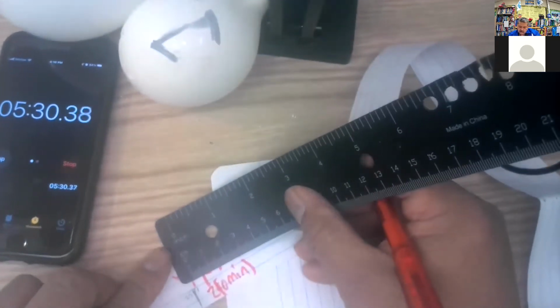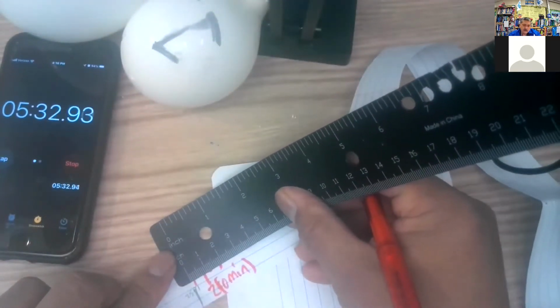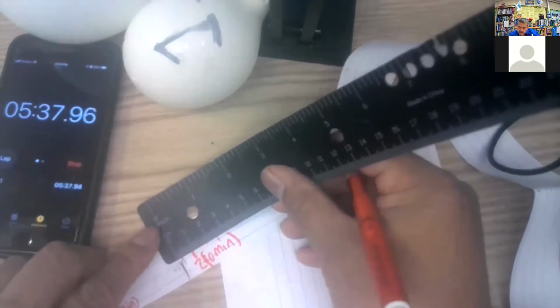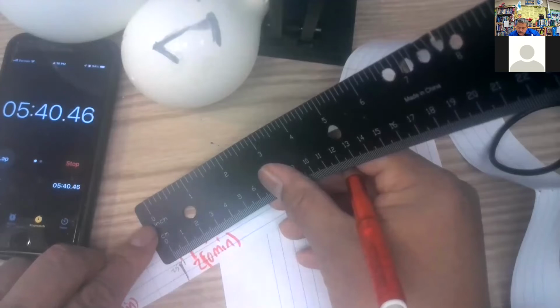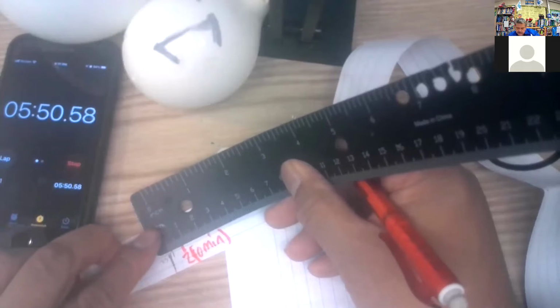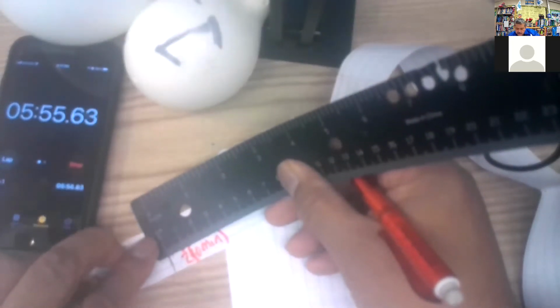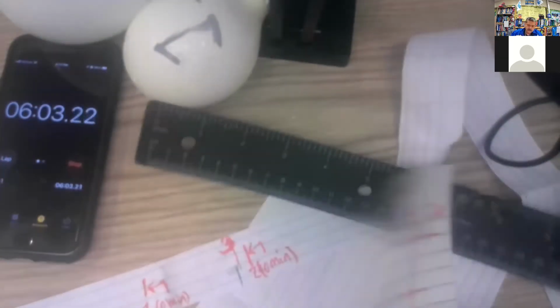And my line is, we can make this 25 point, what, right there, and 5 point, also 4, how can that be? Well, that's 25, and so this is going to be 25.2, and this one is going to be 25 point, close to 8, 25.2 and 25.8.